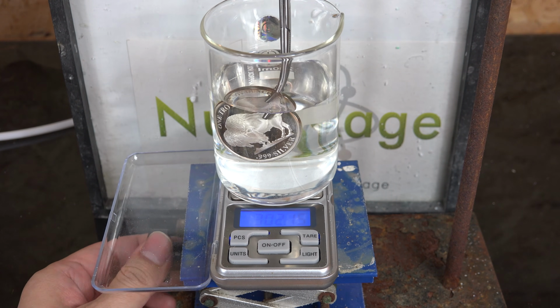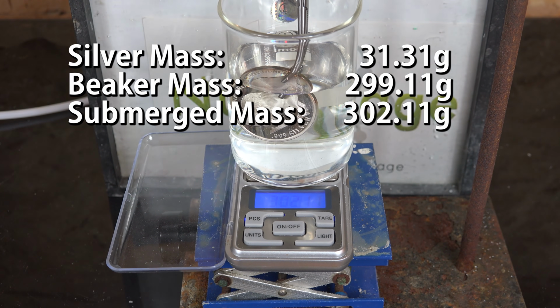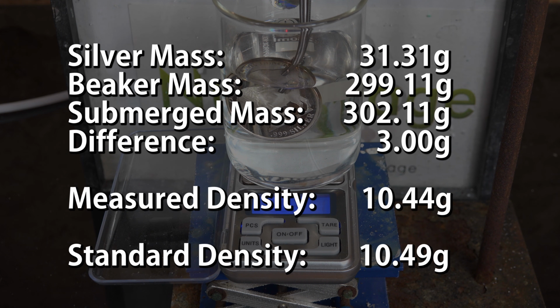It's important I don't touch the sides or the bottom so the mass of the silver round itself doesn't affect the weight. To record the mass, we subtract the original mass to get the difference and divide by the density of water at this temperature to get volume. Now we divide the mass of the silver round by the volume and we get our density.